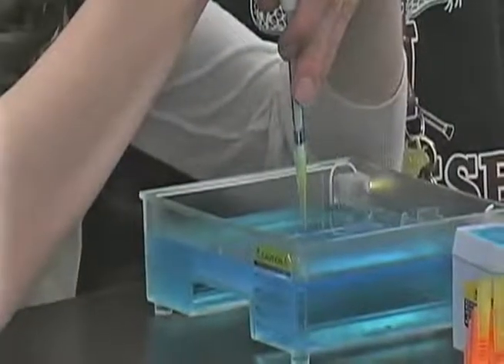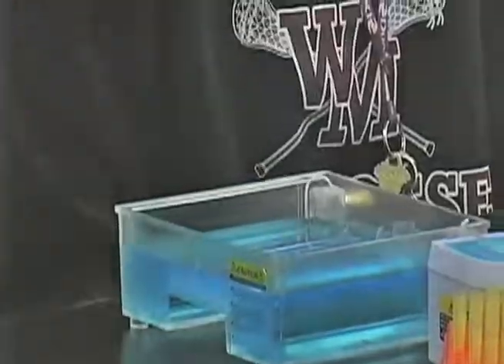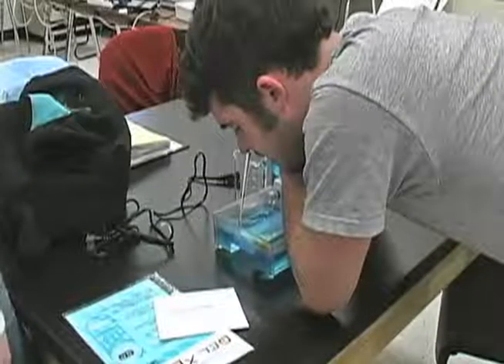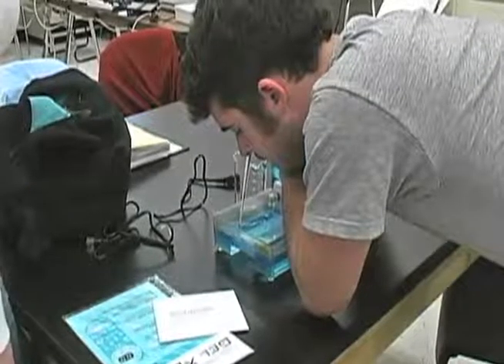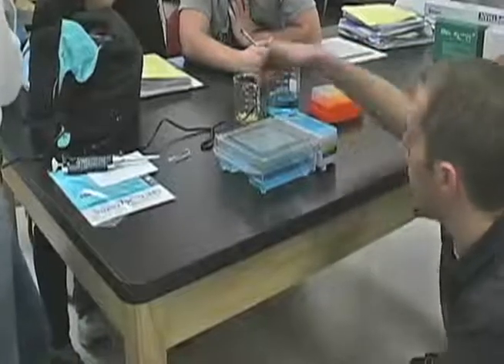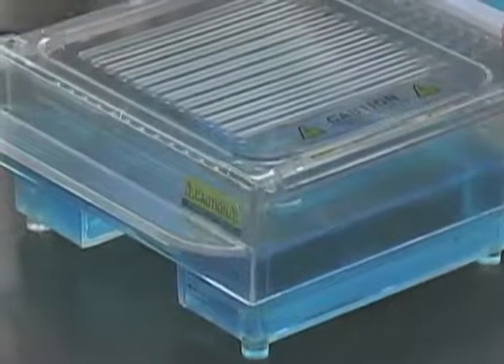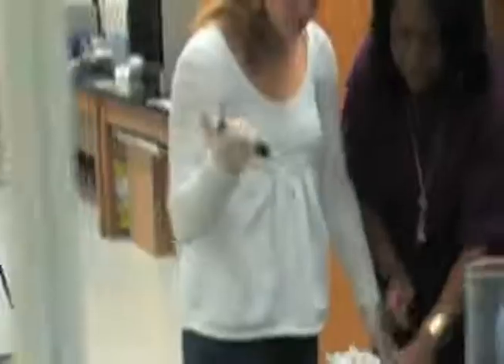This activity shows students using agarose gel electrophoresis to analyze DNA for a particular genetic mutation that causes high cholesterol levels in the blood. Students learn the proper technique for loading the gel with DNA and how electrical currents cause the DNA to travel through the gel at variable speeds.